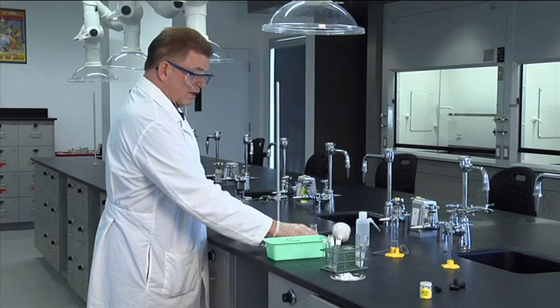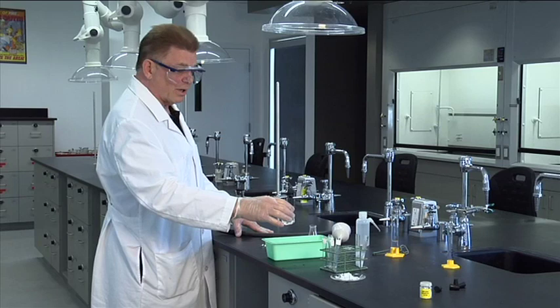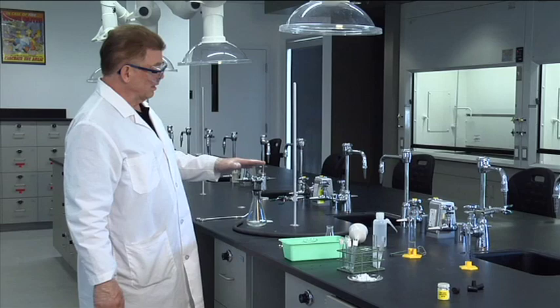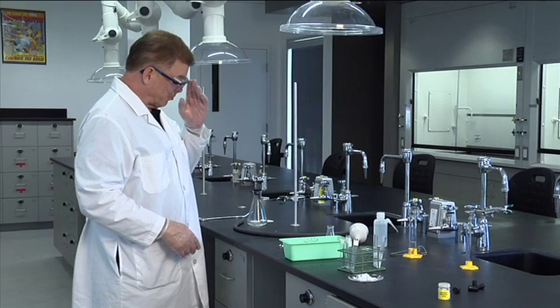To get the last few crystals out, wash with ice cold solvent. In this case it was water but if you're using methanol, it's ice cold methanol. Make sure it's ice cold. Don't weigh or take the melting point of wet crystals. Let this thing air dry or vacuum dry at least 10 minutes before you collect the crystals and take a weight or a melting point.